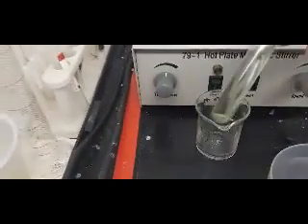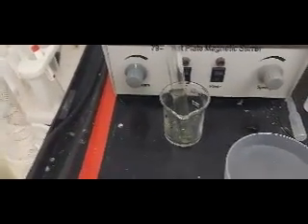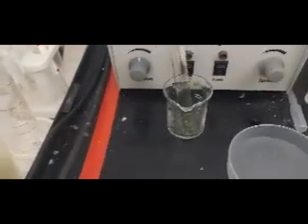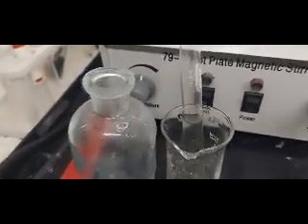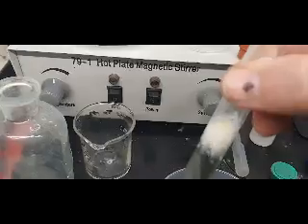You can see the silver nitrate. We could actually turn this into silver chloride to confirm it's silver. I have literally one drop of hydrochloric acid left, but let's see if we can make some silver chloride. There we go — making some silver chloride.